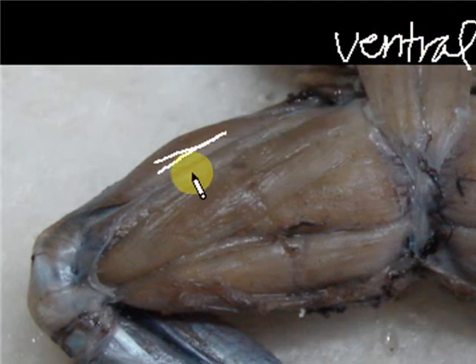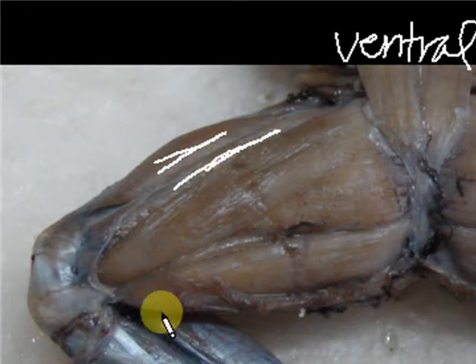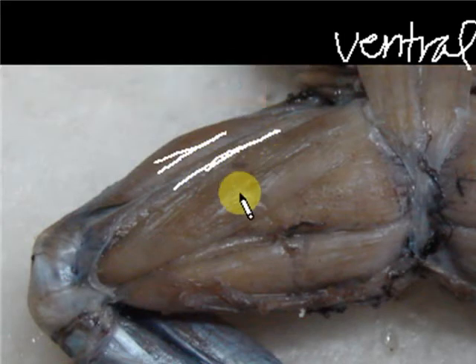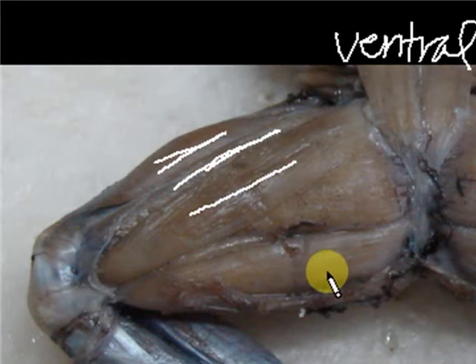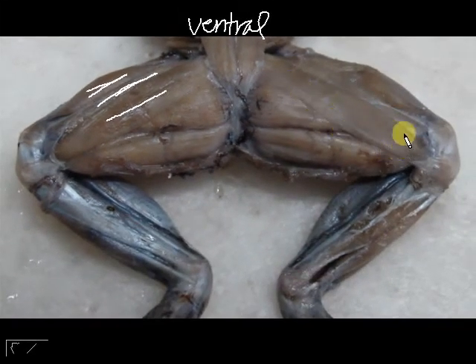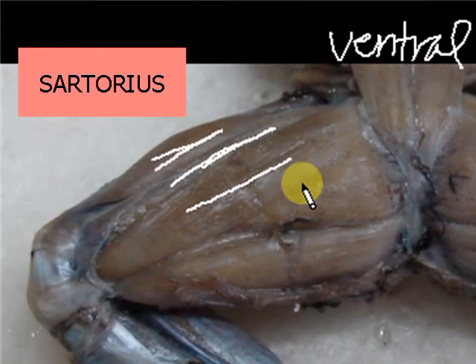Now, the next muscle right here, somewhat. Alright, now that is the adductor longus. Okay, now this muscle here, if you see that in the actual specimen, it's very thin. As you can see, it's like a sheet of muscle that is actually covering the other muscles. That is your sartorius muscle.